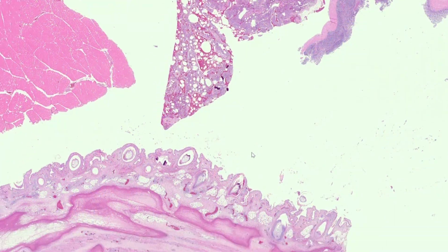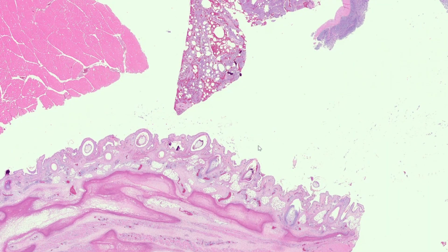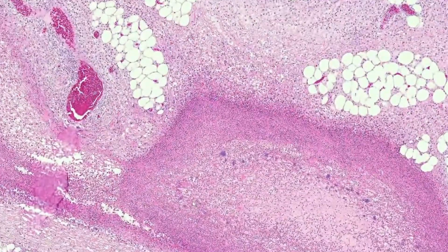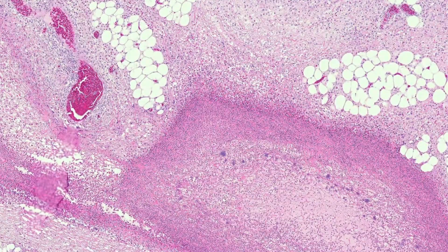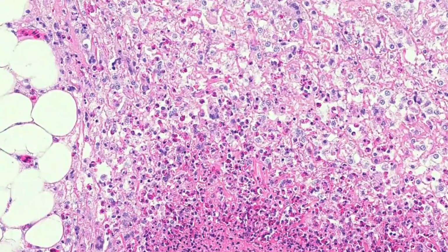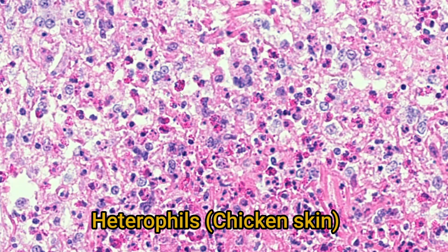Neutrophils are one thing, but have you ever heard of a heterophil? If you're looking at a dog, cat, horse, or cow, you're looking for neutrophils. But if your patient is a bird, a reptile, a rabbit, or a guinea pig, the acute inflammatory cell is different. In these species, you have to use the term heterophil. These cells look quite different to neutrophils. Rather than having homogeneous, pale cytoplasm, heterophils are packed with large, pink cytoplasmic granules.